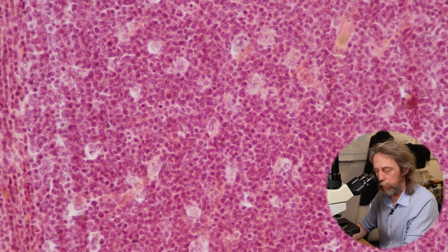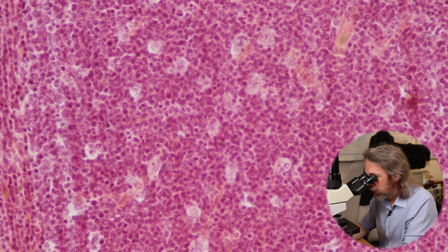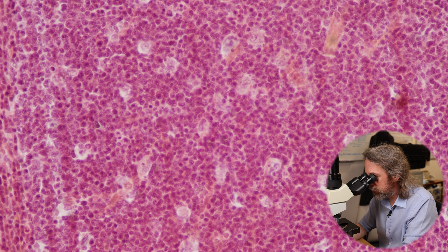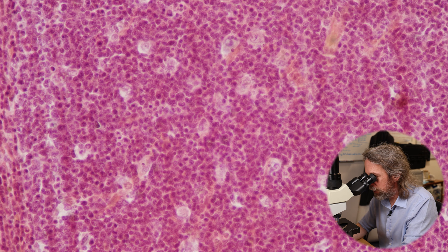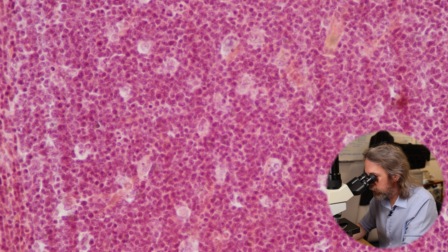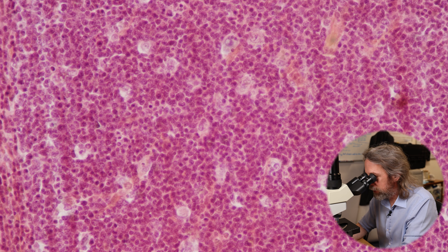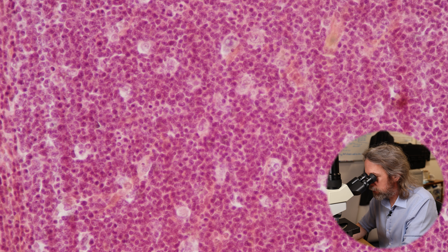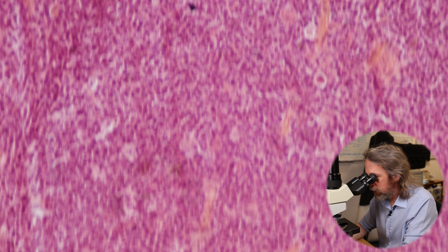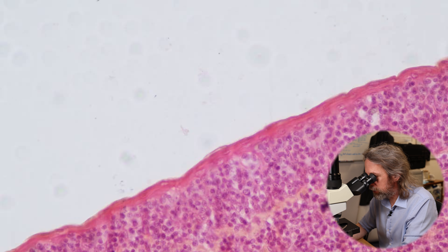There's a good nodule with lots of paler cells in there — I'm guessing most of those will be macrophages surrounded by B lymphocytes in the nodule.